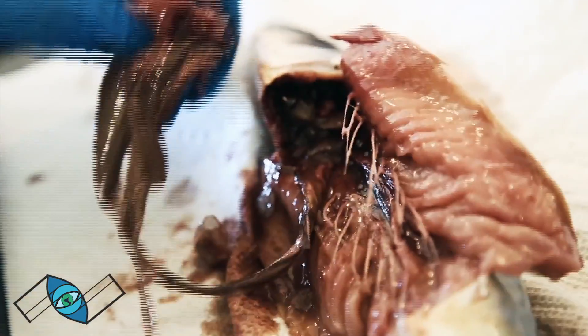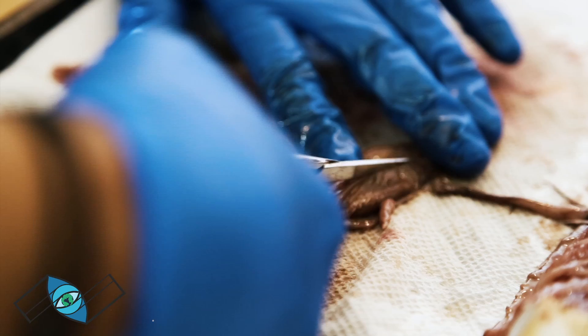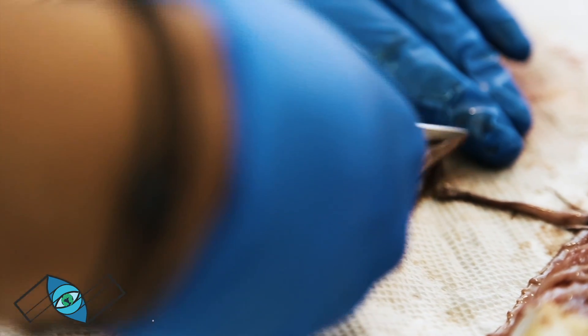And that's how we're gonna get access to its gut to analyze its gut contents. So then go ahead and open it up. It looks like little shrimp bits, but it's gonna be all mush.